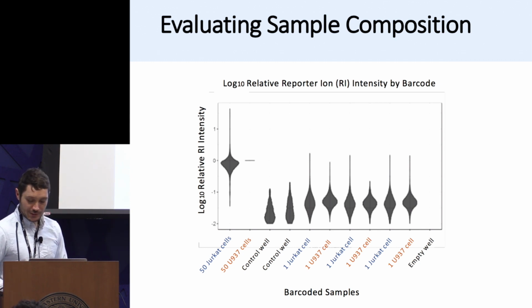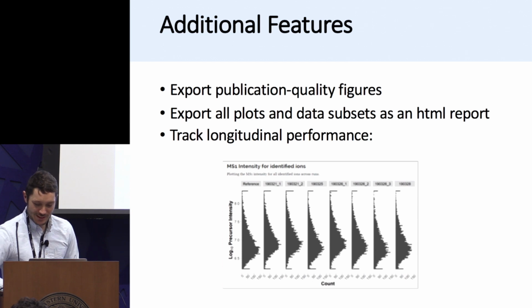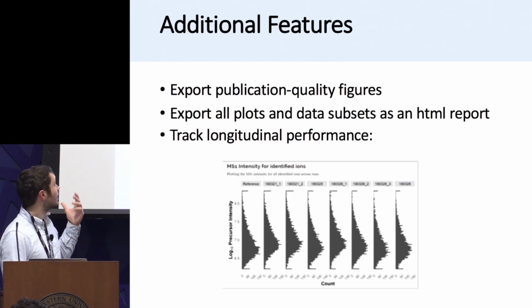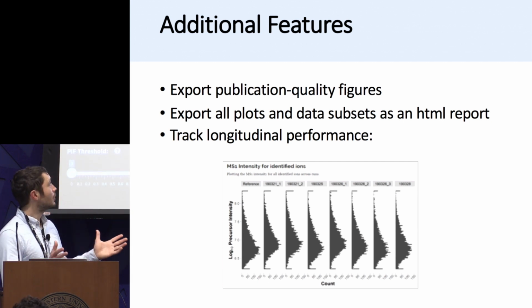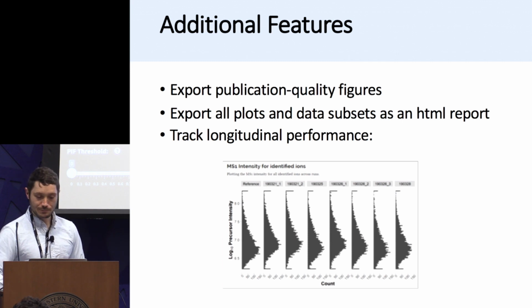Now, some additional features that I'll get into through this live demonstration are the ability to export publication quality figures, subset your data, and also track longitudinal performance, but we'll come back to that momentarily. So what we have here is DoMS open in a web browser window. I'm going to load a data set for us to take a look at.